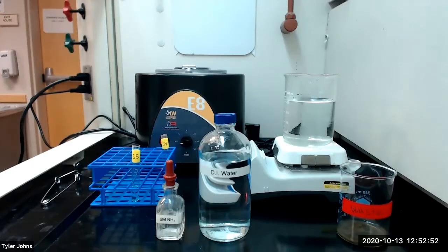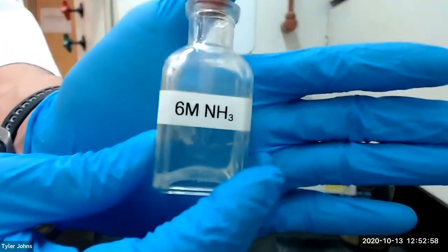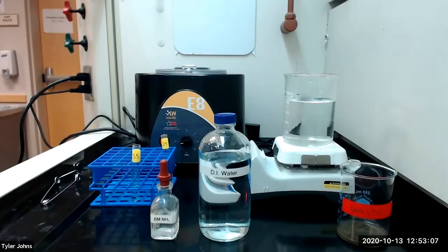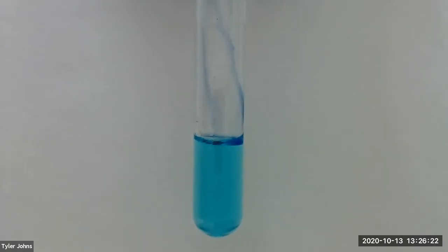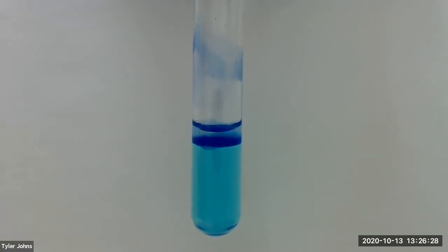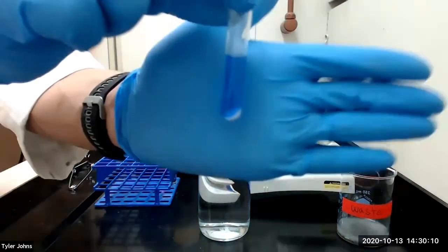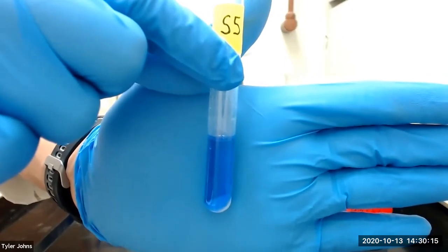We will now perform a test for copper 2 ion. To solution S5 we are going to add 6 molar ammonia until the solution is basic. The appearance of a darker blue-violet color in solution proves the presence of copper 2 ion. After centrifugation, you can see within our S5 test tube that the blue solution indicates a positive presence for the copper 2 ion.